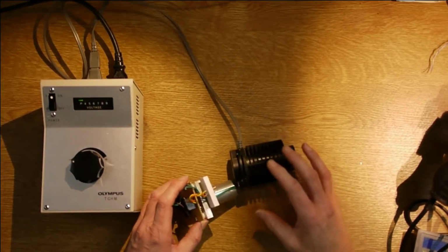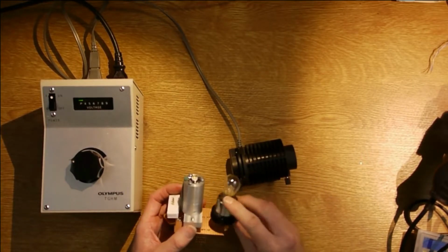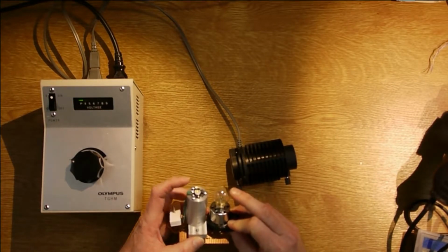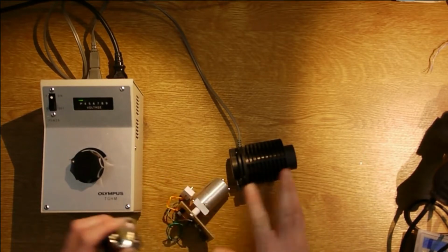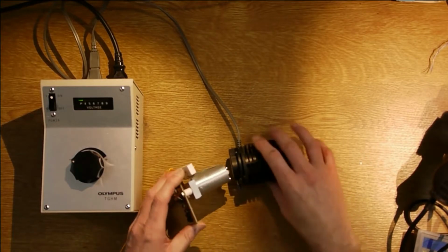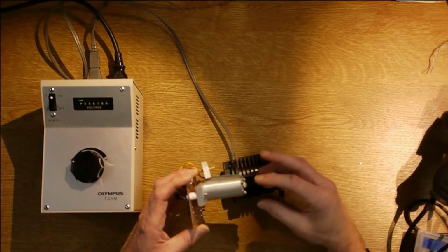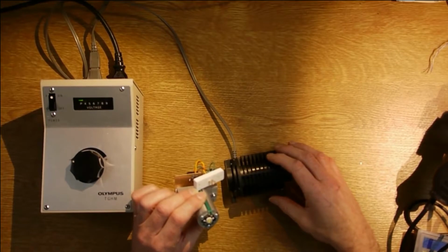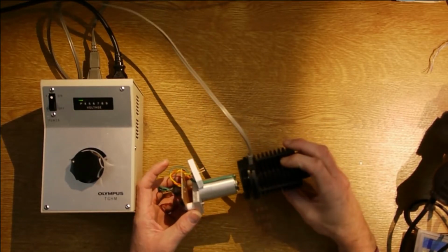If you look at the aluminium, you can see that when that's plugged in, the filament is where the LED is mounted. So the physical arrangement of the illumination is the same as when the bulb's in there. Now, if you don't do that, and you move this in or out this way, you end up with a bright spot in the middle of the field of view of the microscope. So this does work quite well. It is brighter as well than the bulb.